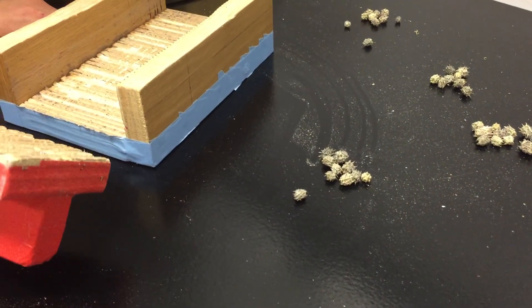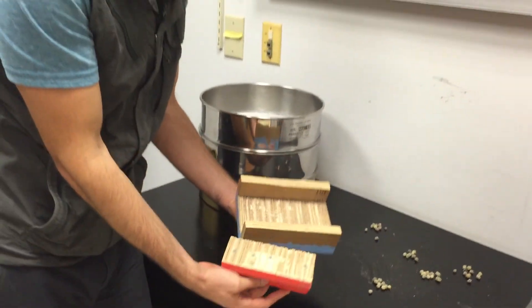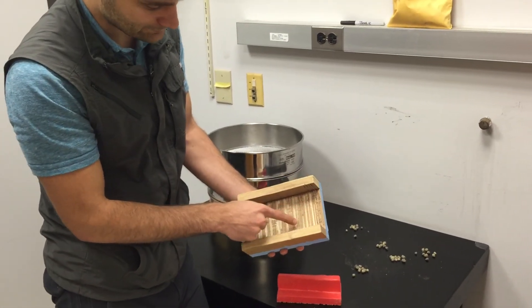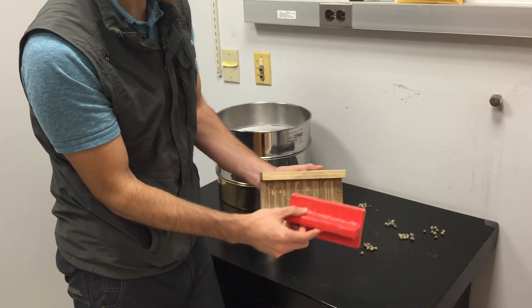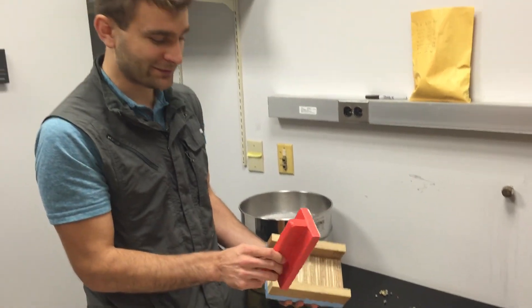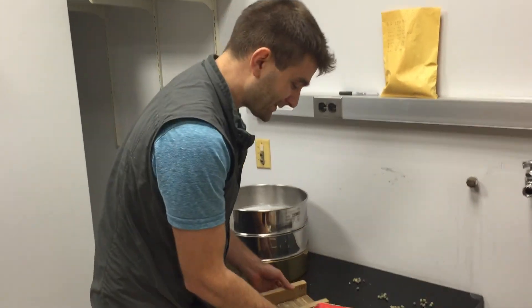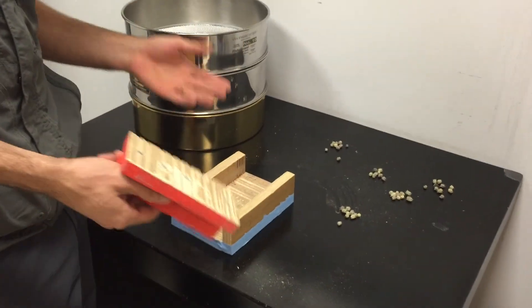To do this, I originally made this contraption here. It's just wood that I have cut some grooves into on the top and the bottom. I also reinforced it with tape because over time with prolonged use it's starting to slowly fall apart. I think the tape helps keep it together. This is probably not the best method to do this, but it works — it works really well.